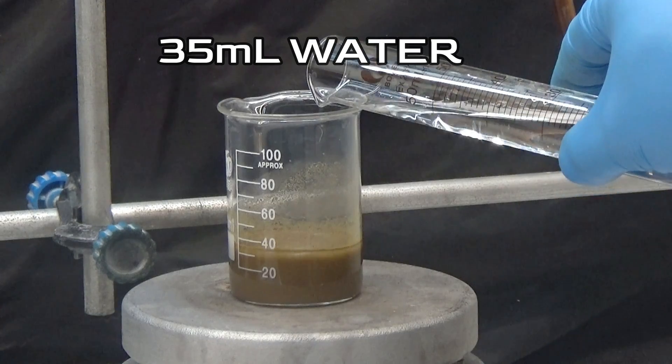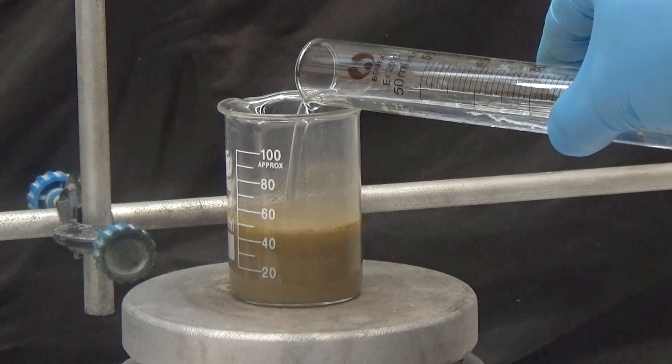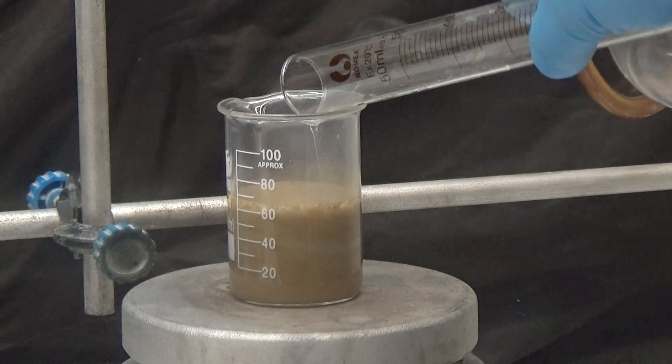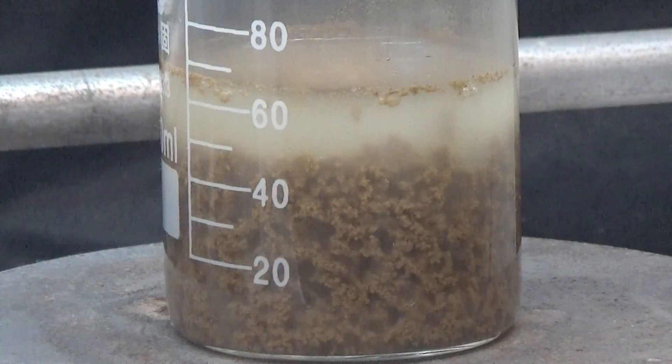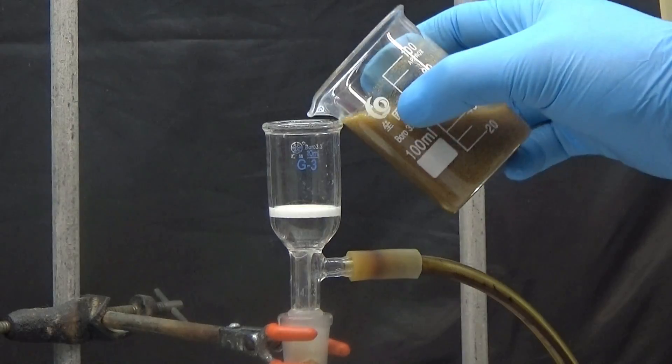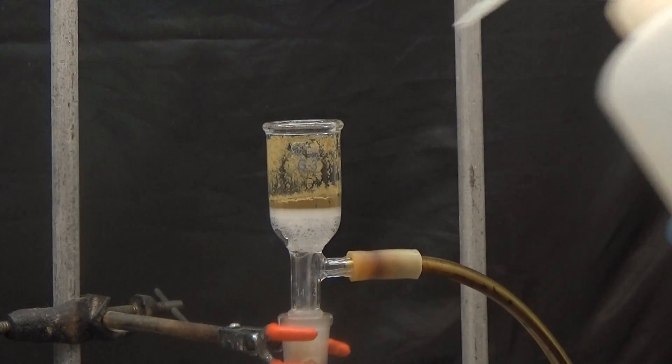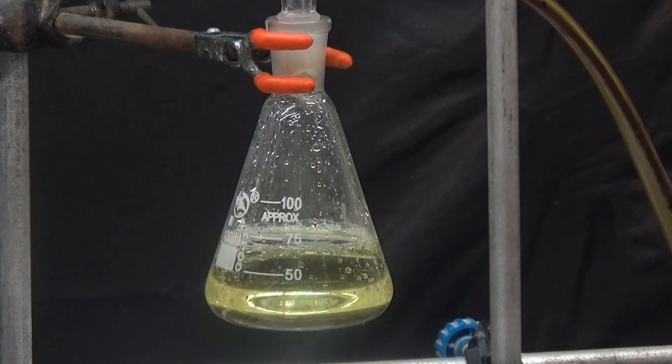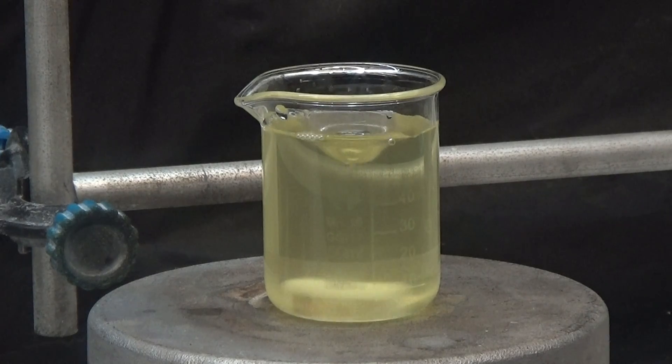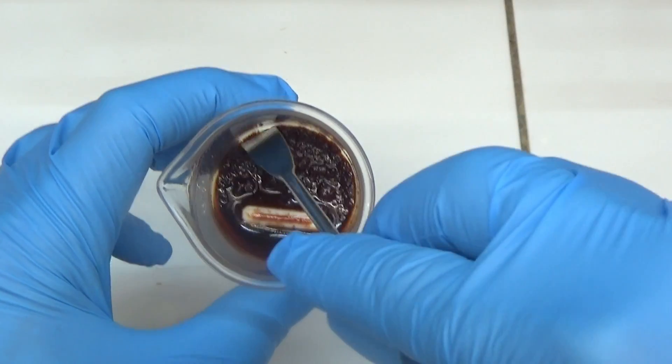Dilute with 35 ml of water after 3 hours. Stir in for a short period of time and allow it to rest. Filter to separate the solid and wash the solid with a little water. The filtered liquid should be evaporated to a volume of approximately 10 ml. We allow it to rest and store it in the refrigerator until it crystallizes.